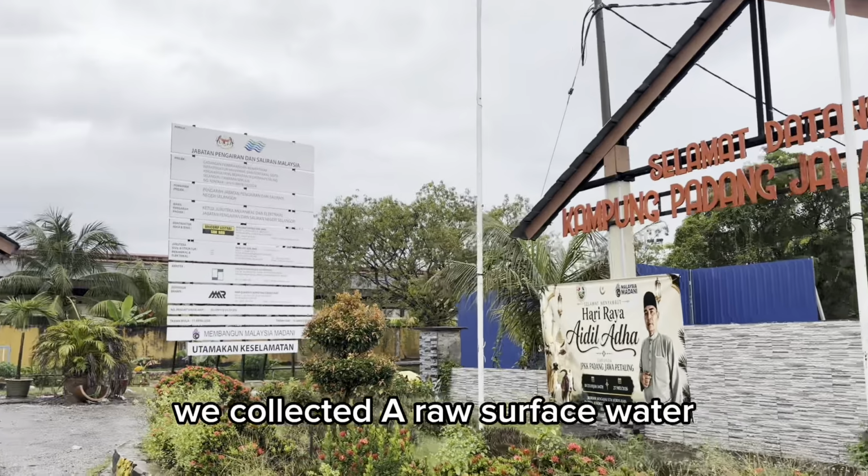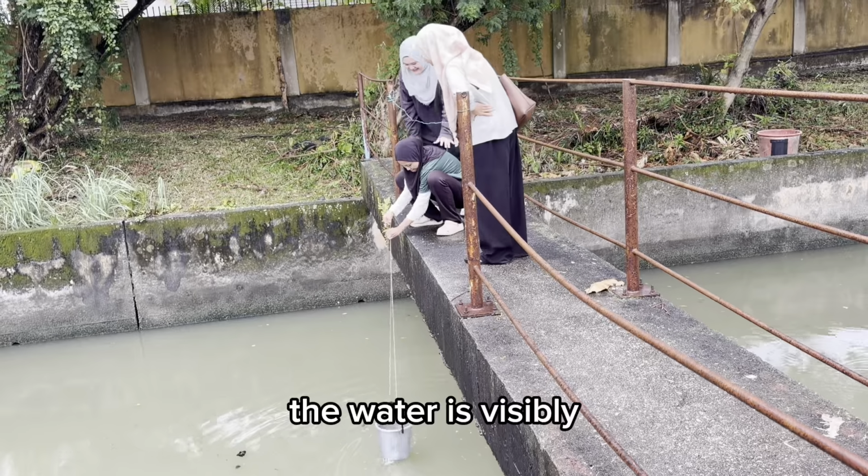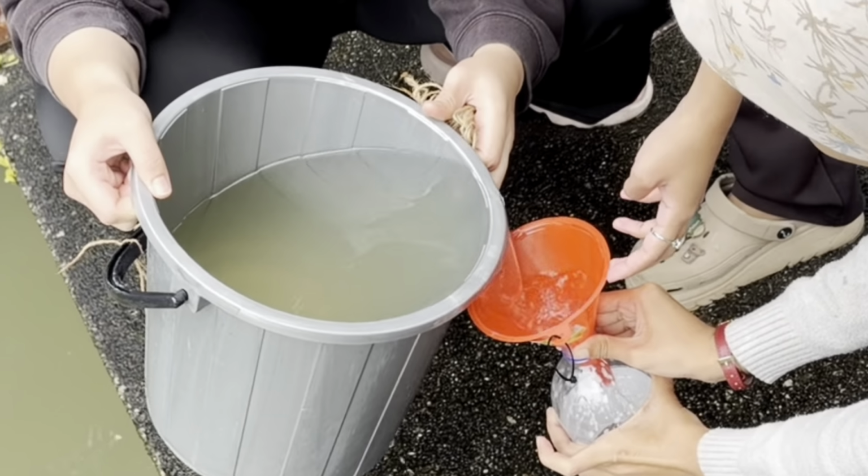We collected a raw surface water sample from Klang River in Kampung Padang Jawa, Petaling. As you can see, the water is visibly turbid and contains suspended materials, requiring proper lab assessment and treatment.